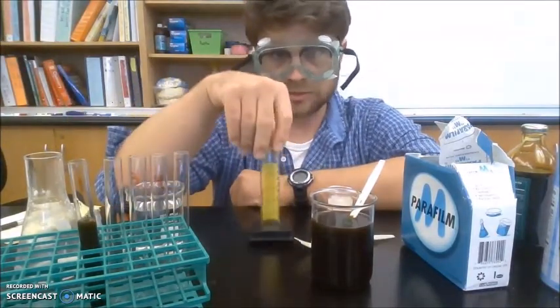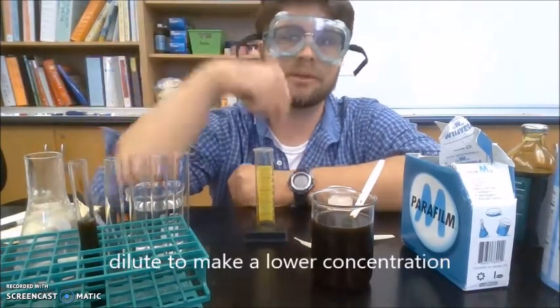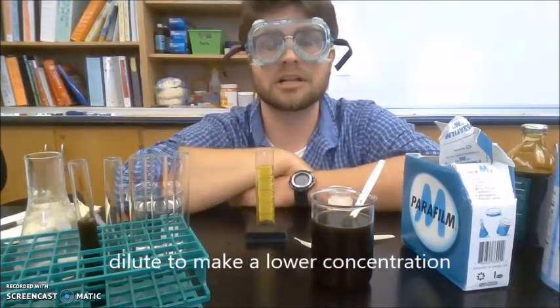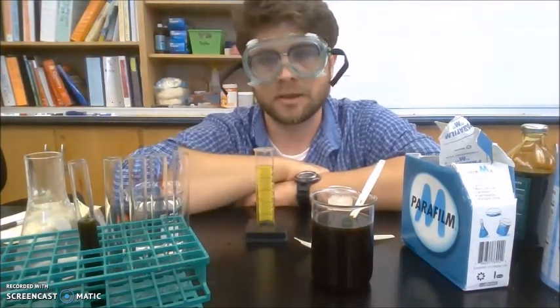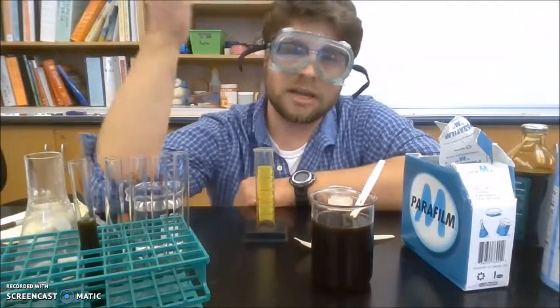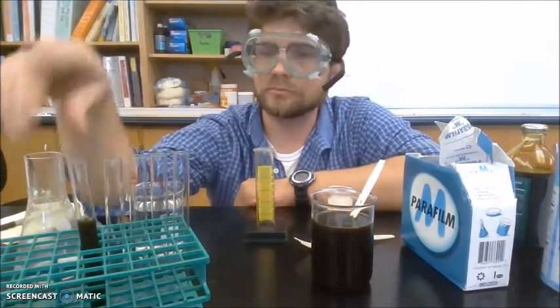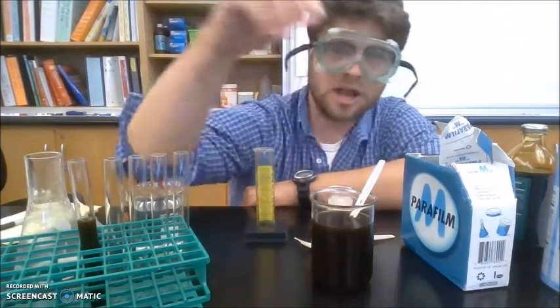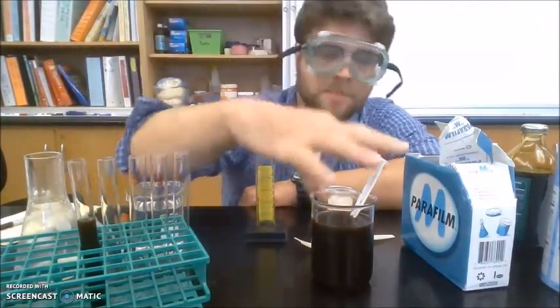All right. So now in test tube 2, I want to start diluting the molasses. I want different concentrations of molasses to test my yeast in. So number 1 acts as our stock, our baseline. For 2, I want to dilute it by half, by 50%.